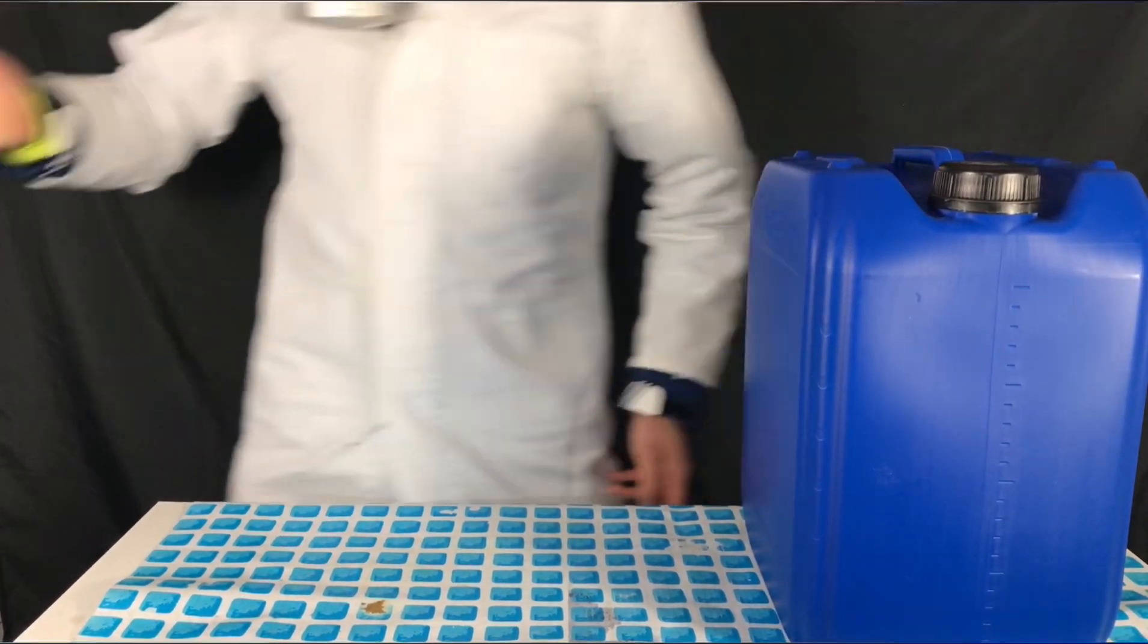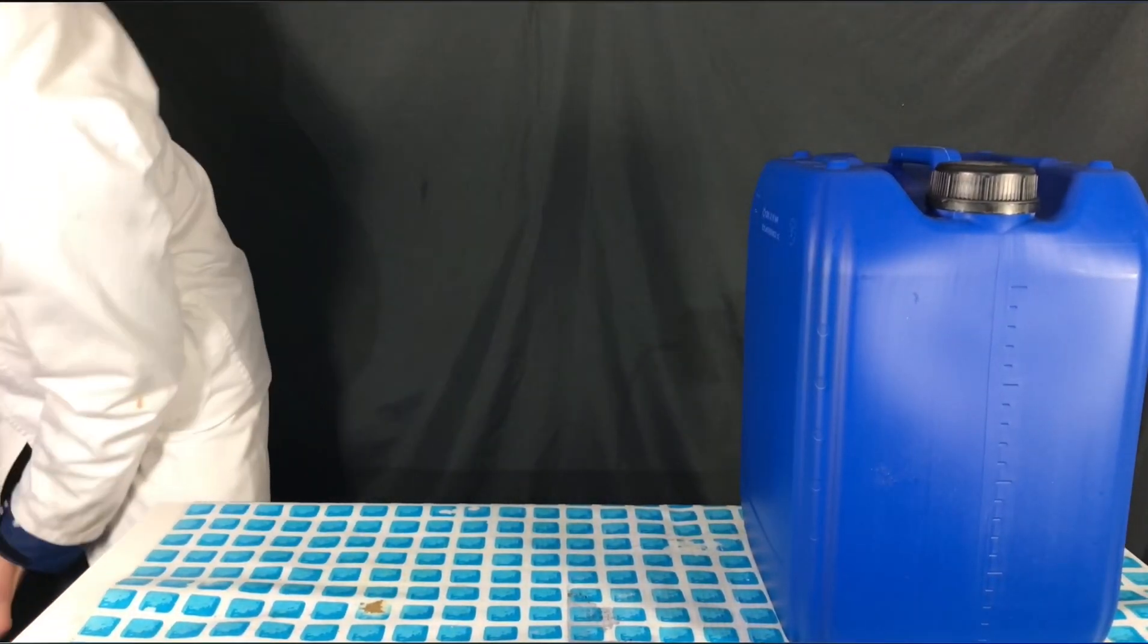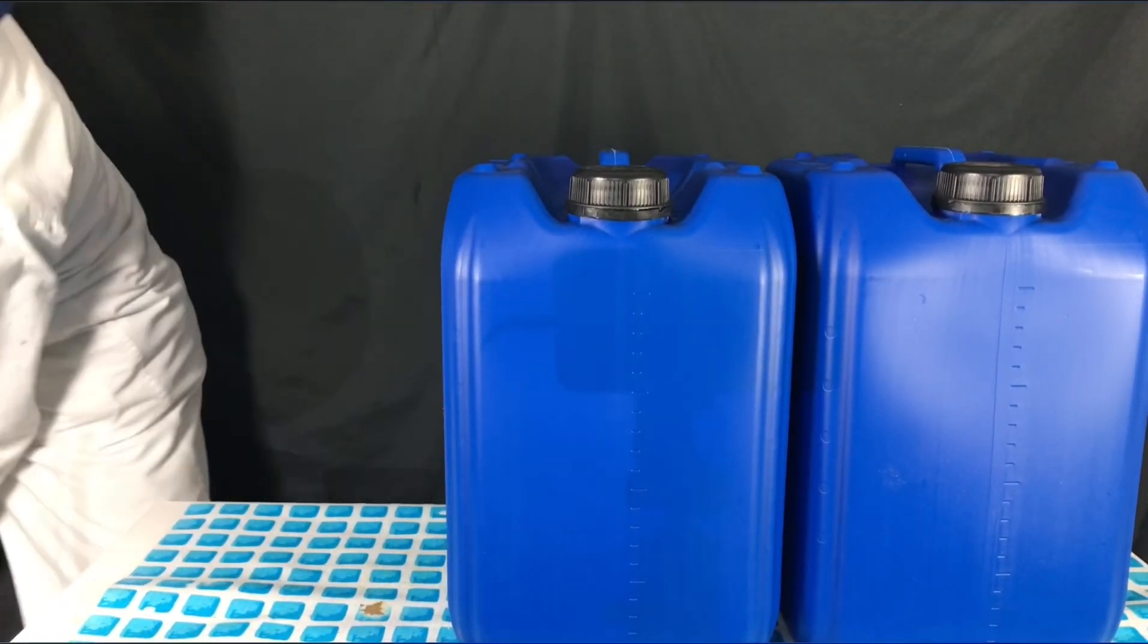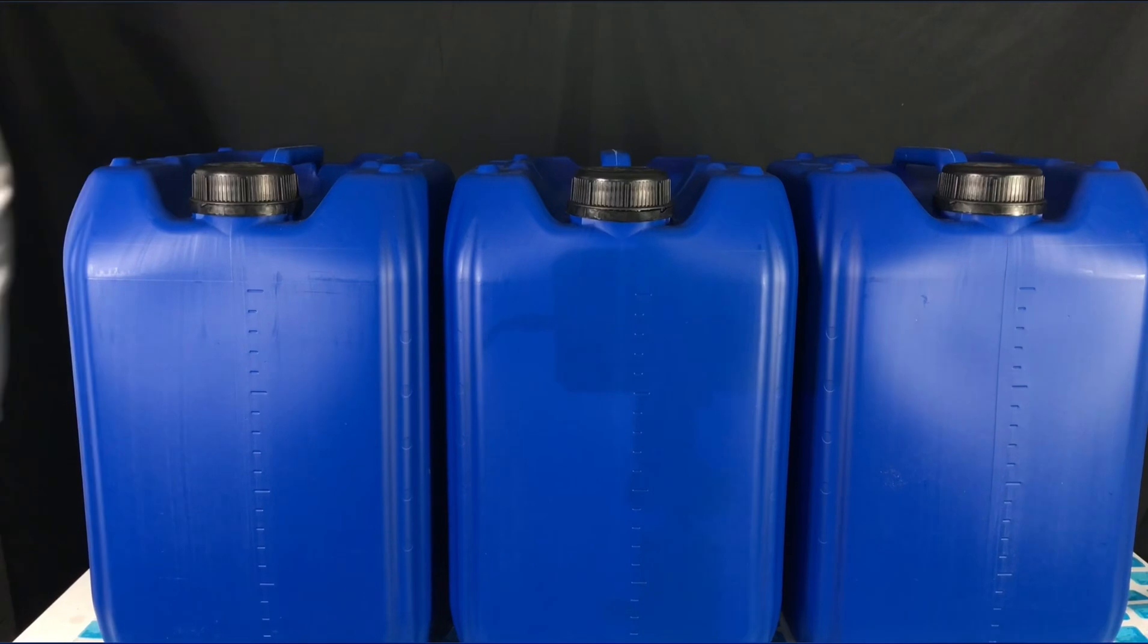In the end, we were left with 57 liters of sulfuric acid with a concentration of below 15%. To be even more specific, I can tell you that the sulfuric acid should have a concentration of about 14.3% by weight.